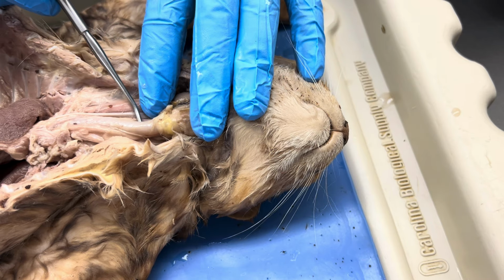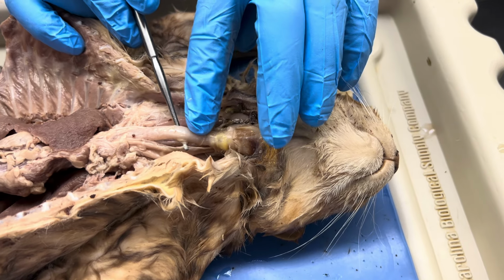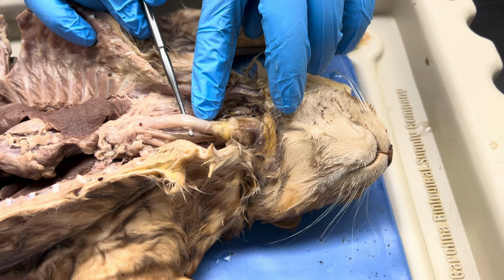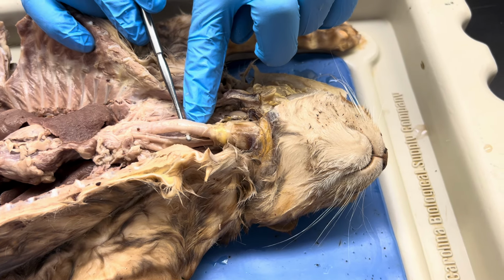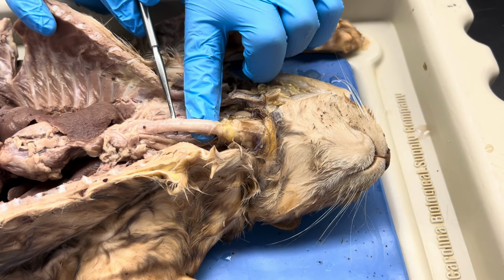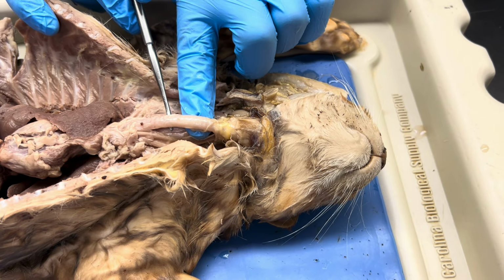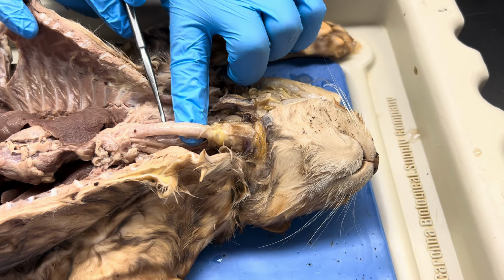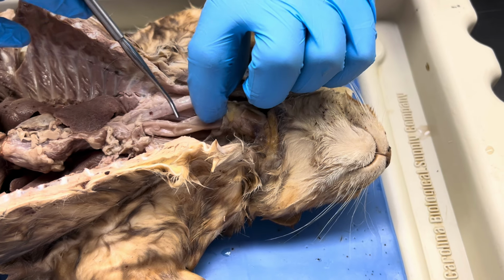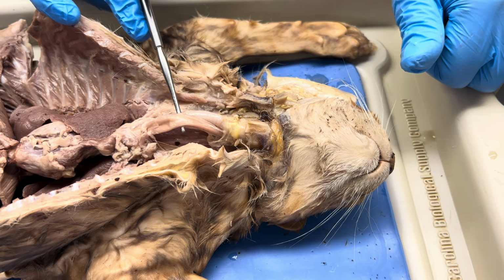So with the trachea, this is it right here. I'm gonna lift it up right there. You see the little kind of bands? They almost look like a more intense color of white, so it's kind of clear then white, clear then white. Those are called tracheal rings, and that's what helps reinforce the trachea and keep it open. Now, located behind the trachea, that's where you find the esophagus. So here's the trachea. We're going to lift it up, and then behind the trachea here, that's the esophagus.